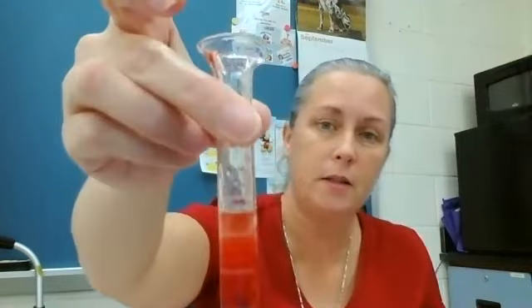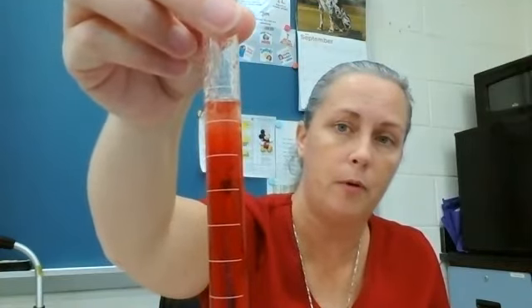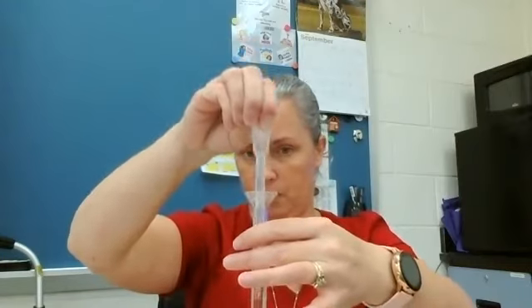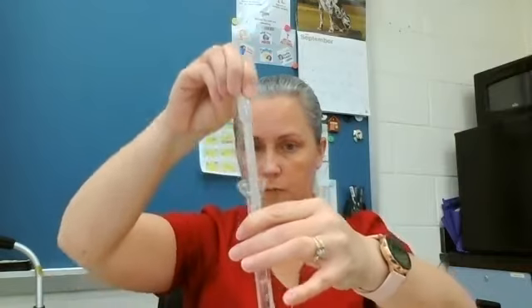Now we're going to do number three: stir the contents of each cylinder with a stirring rod and then let it sit. I'm going to use this one again — this is why I did red, I just splashed it all over my desk. We stirred that — it's still mixed but at the top you're still getting that oil separation. All my dye goes to the bottom where the water is. Number four: explain the actions of the dye using terms such as solution, hydrogen bonding, and polarity. If you don't know what hydrogen bonding or polarity is, go look them up.